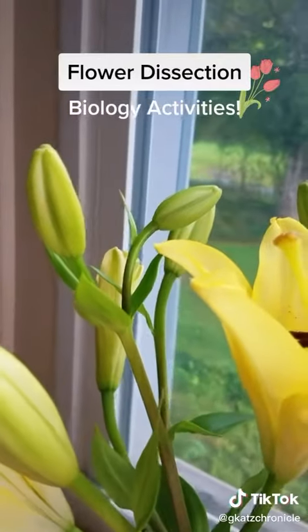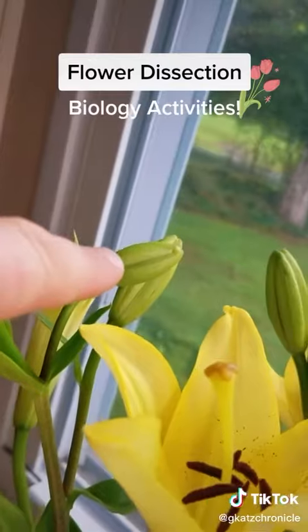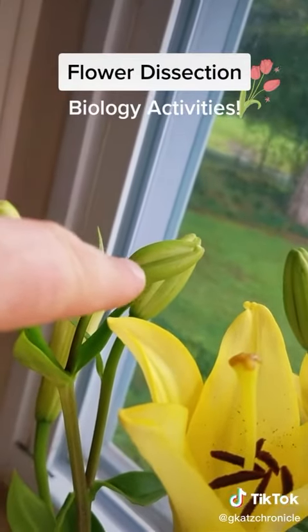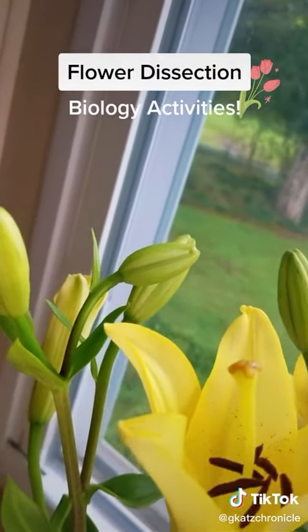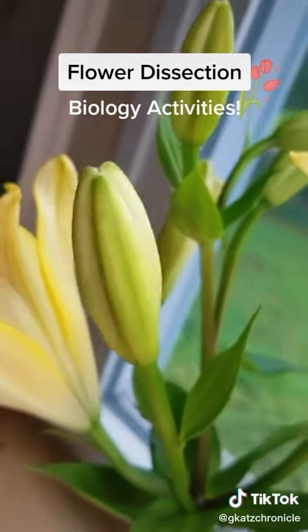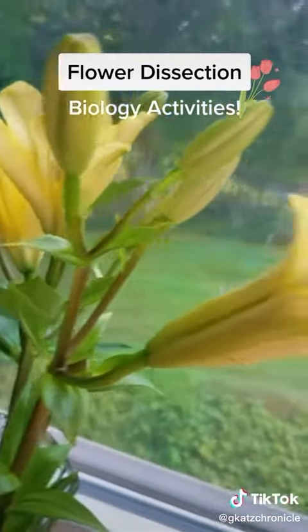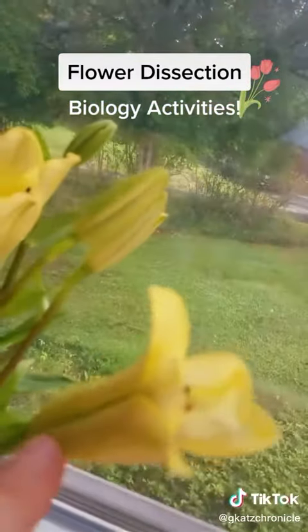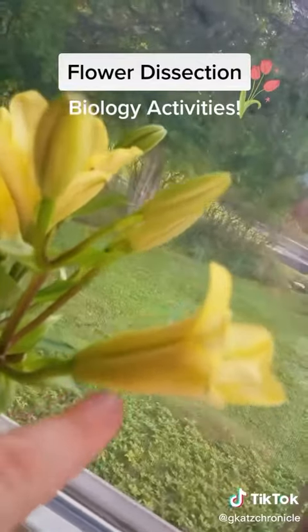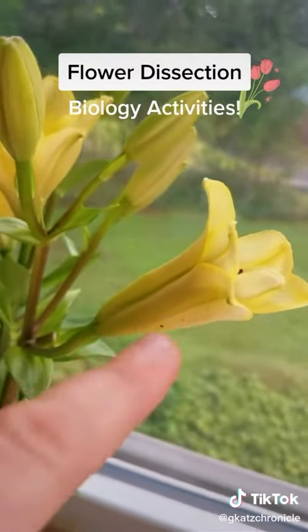Some differences in these sepals in their different levels of development. So you see very young in the flower's development, the sepals are smaller and green, and you see it starts to elongate and turn yellow as it gets a little bit more mature. There's a mature flower. And here you see the sepal just beginning to open. It's elongated quite a bit and it's turned yellow.